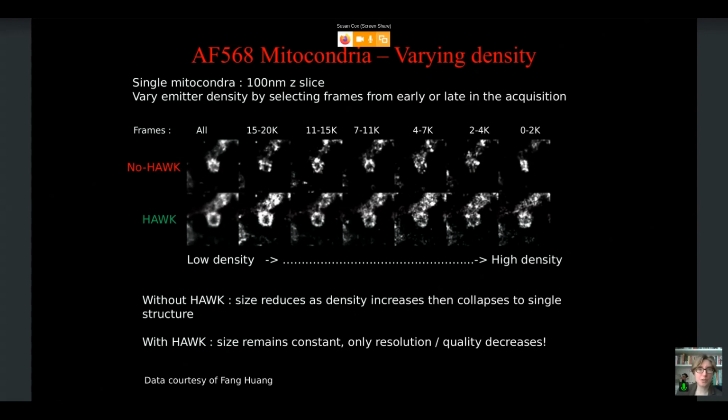And we can also test with that biplane data, varying the density. We had different densities at different points, and you can see as we go from low density, without and with HAWK look pretty similar, up to high density where the HAWKed image on the bottom right looks pretty similar to the low density image on the bottom left, but the no HAWK image on the top right looks very different from the no HAWK image on the top left.